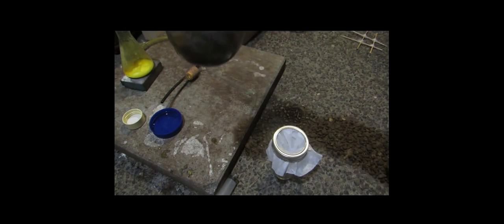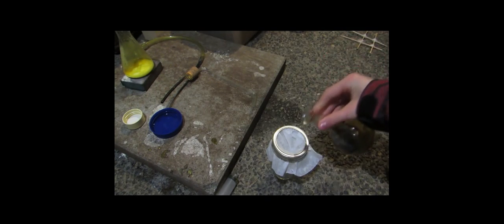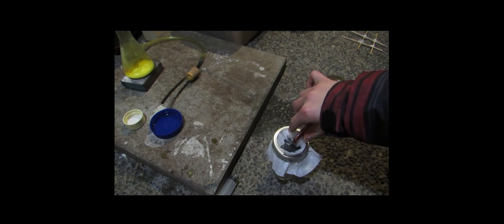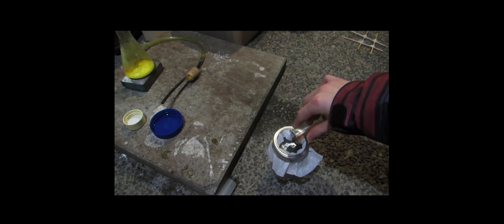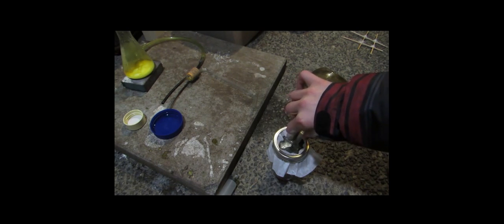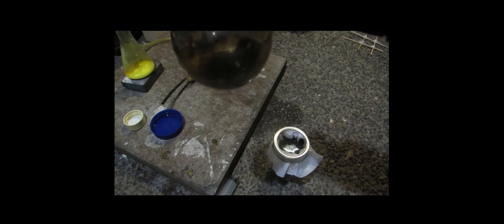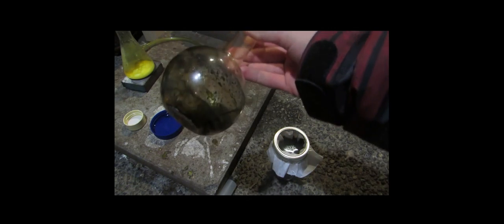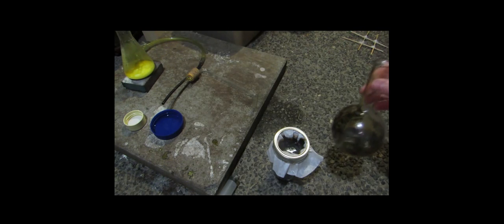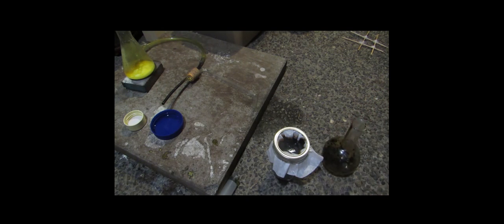Okay, so once you're happy with your yield of iodine, then you're just going to filter it off. So, let's see what we got here. Pour it into the coffee filter. It kind of reminds me of bromine. I bet I could make bromine the same method with potassium bromide instead. So, you can see all that stuff in there, all that gunk left over, that's all iodine. So, I'll probably end up trying to rinse that out into our filter. You can also see there's lots of iodine in your filter.